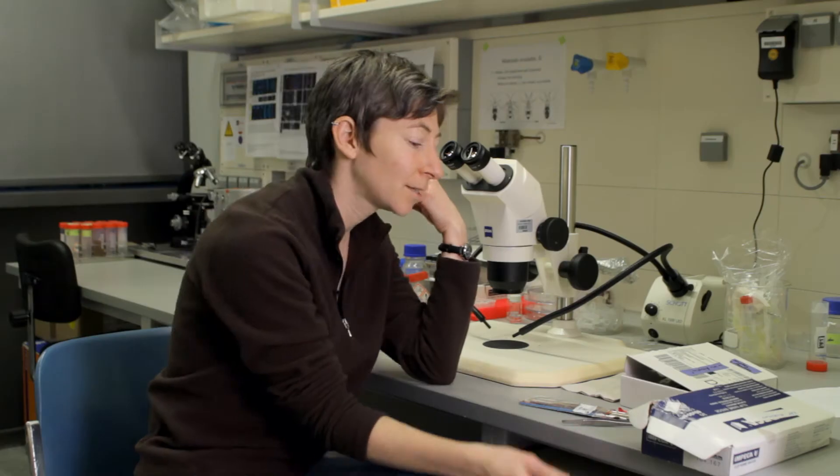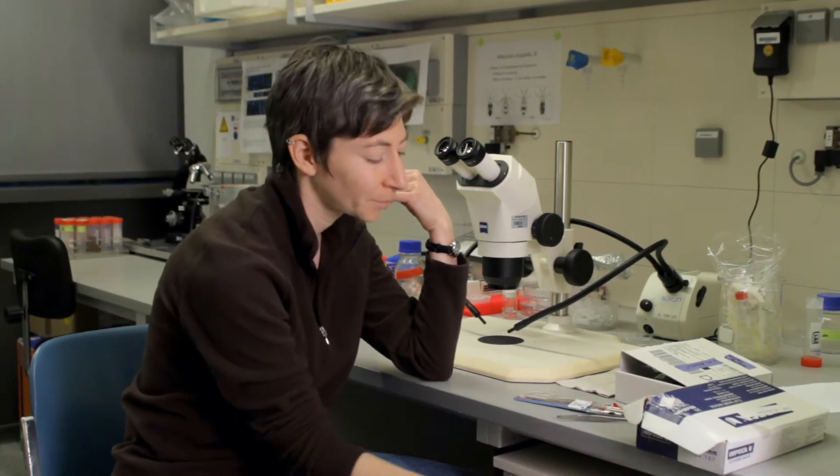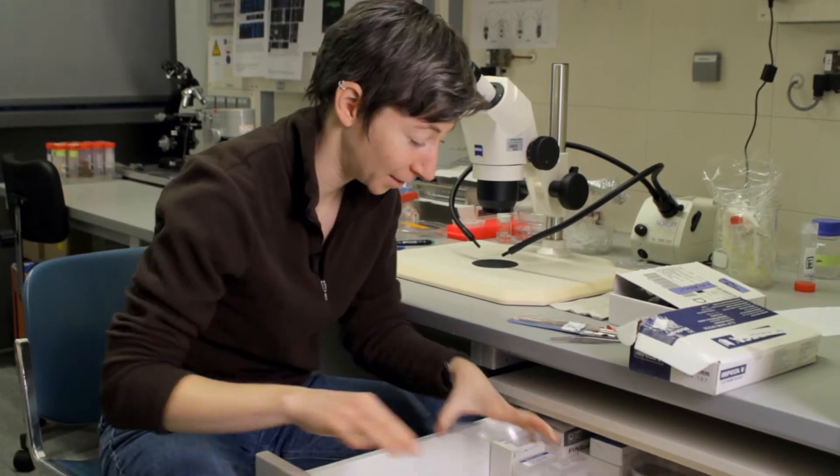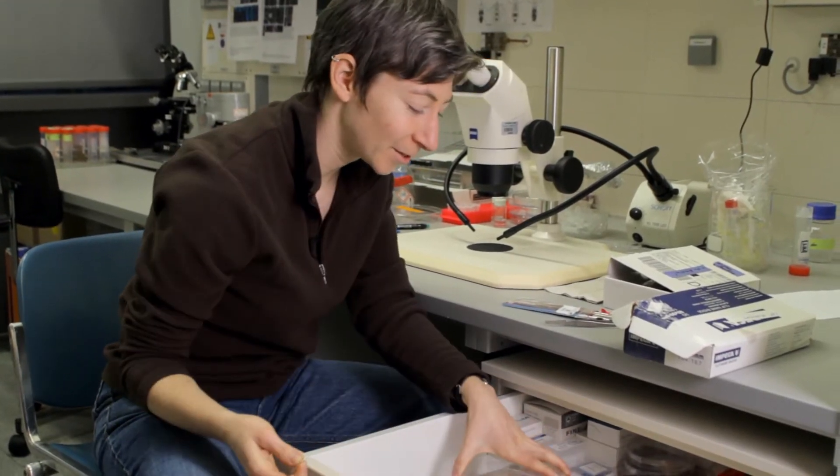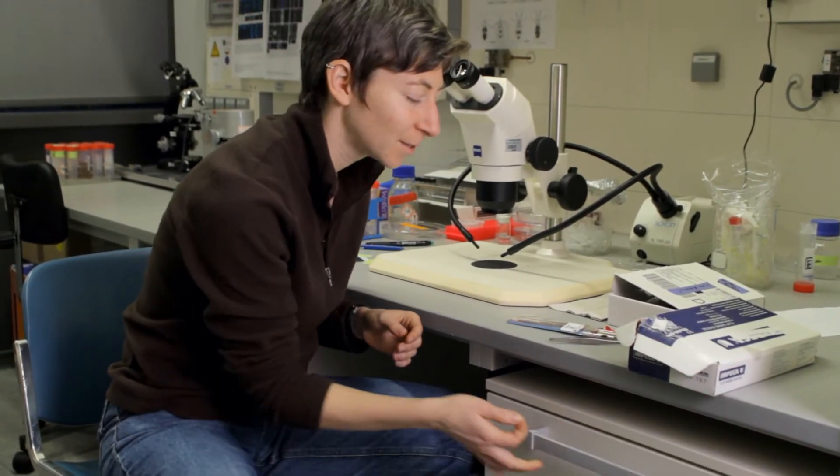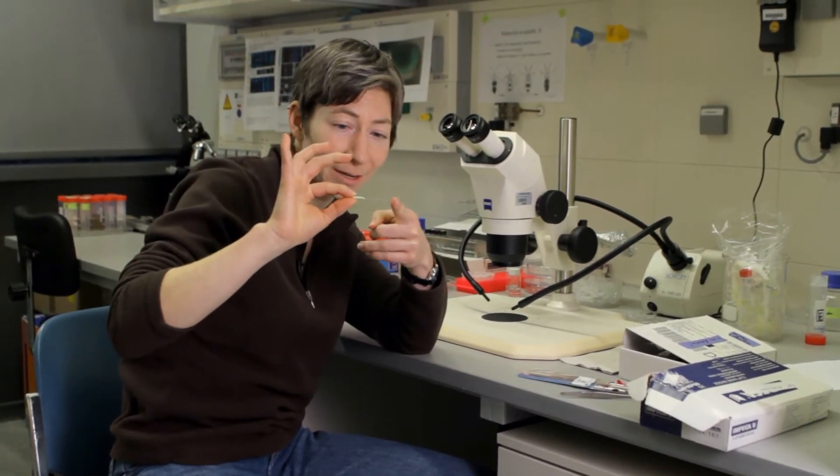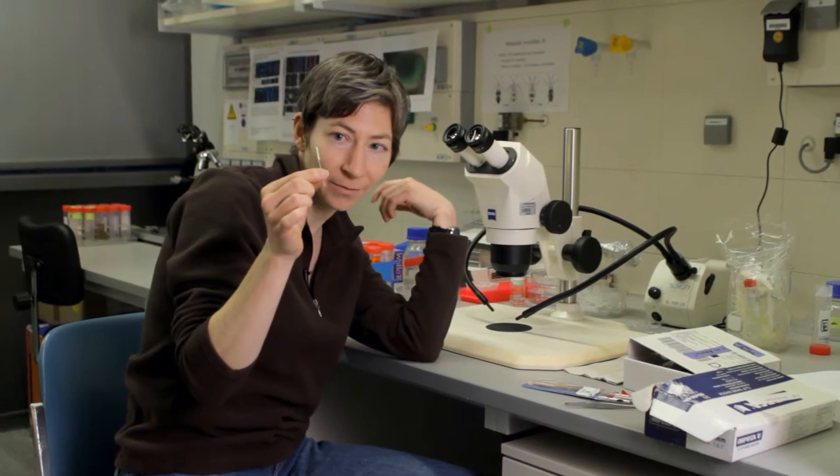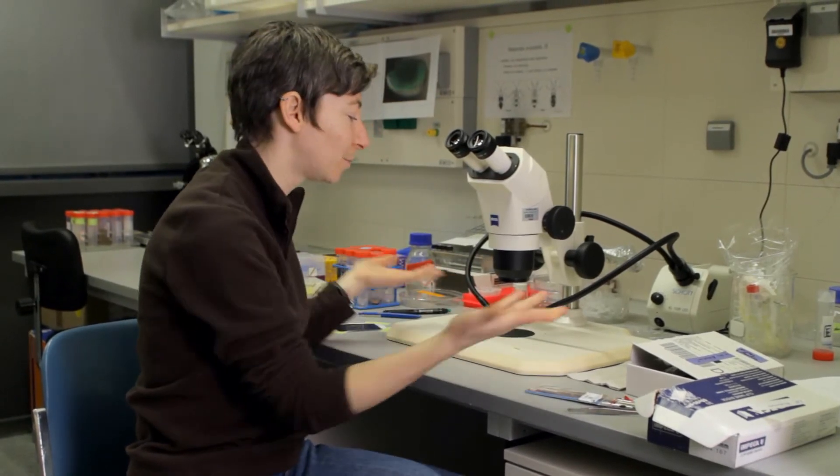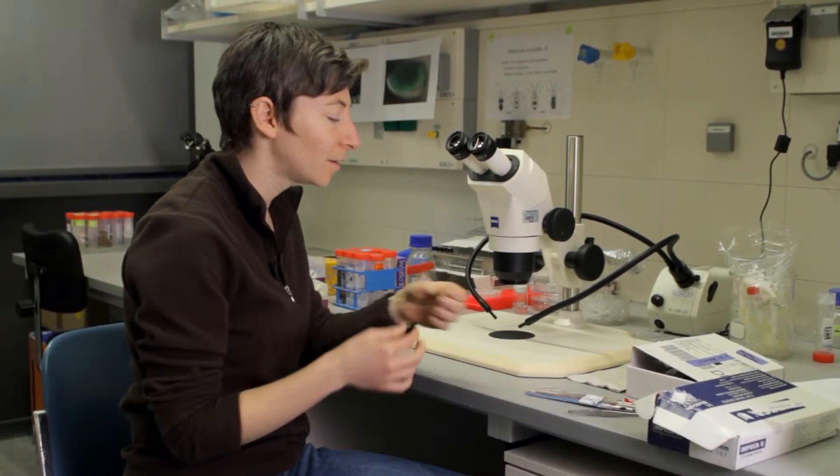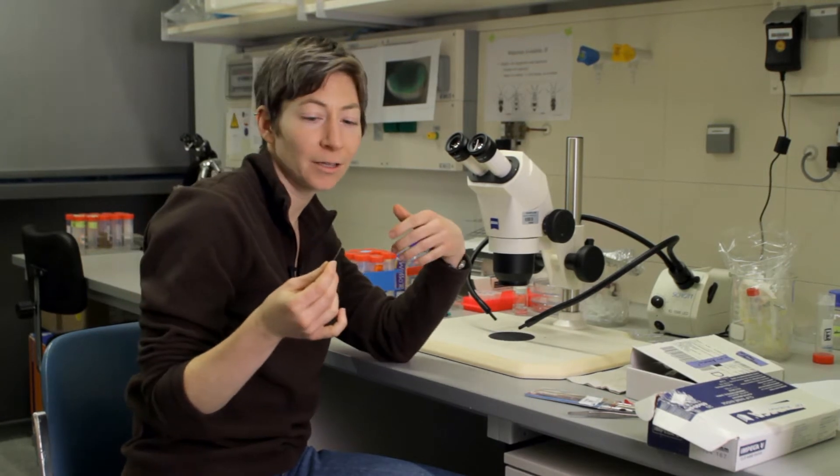Maybe it gets down to a single hair, and actually my most favorite tool is a glass stick. That's it. That's all it is. It was a glass capillary tube—I don't know how well you can see that. It's not very big at all. The bit of labeling tape is just so I can find it when I put it down somewhere. All I did was take a cigarette lighter and flame the end to make it soft.